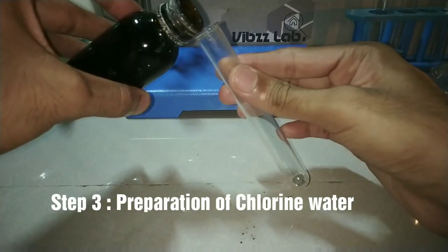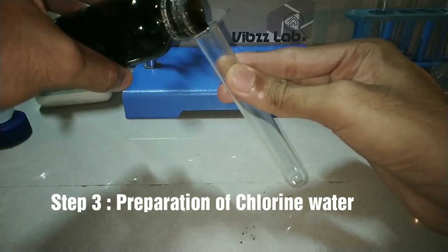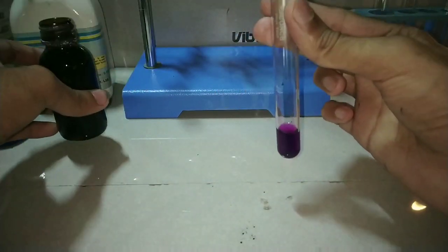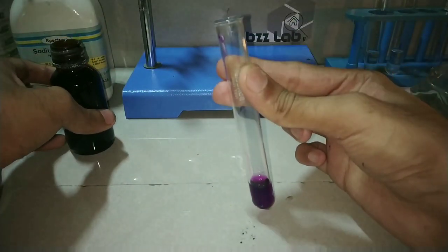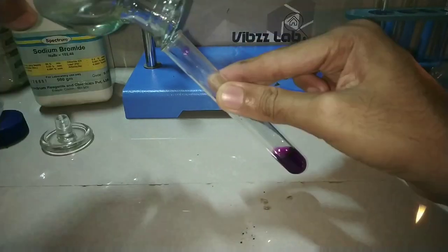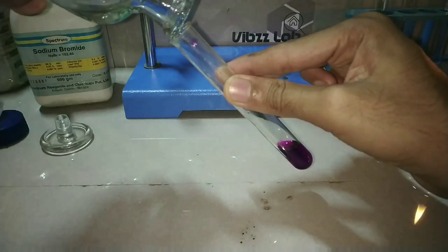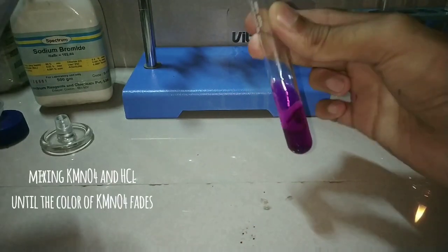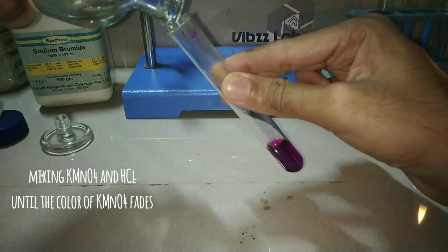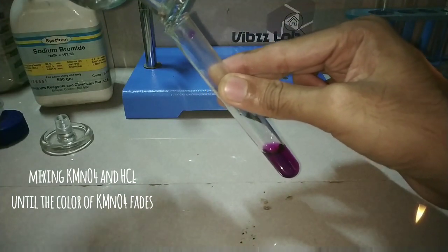Now we will be preparing the chlorine water. It is prepared by taking a little amount of potassium permanganate solution and adding concentrated hydrochloric acid into it until the color of the potassium permanganate changes to a pale brown color.